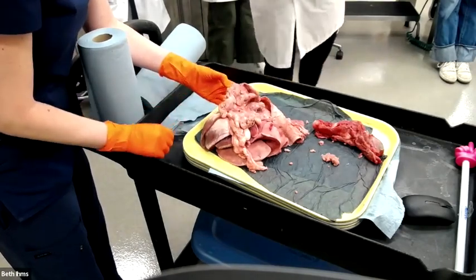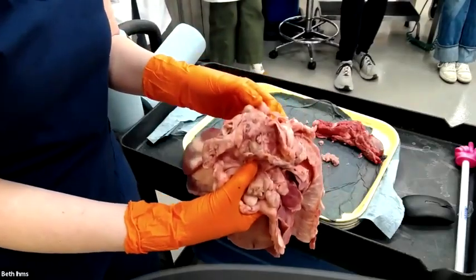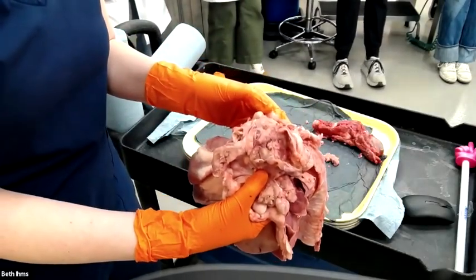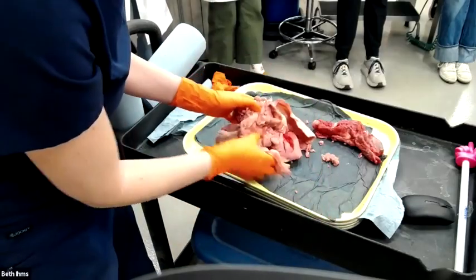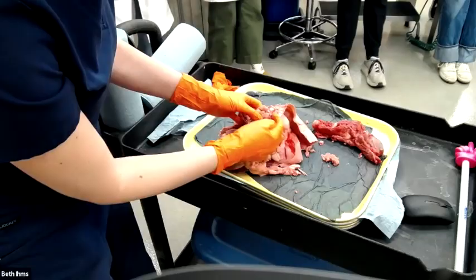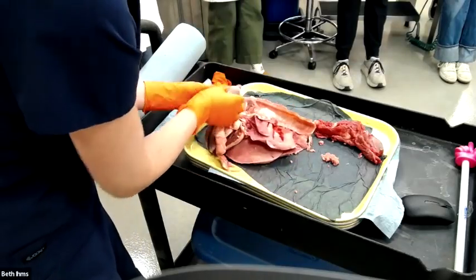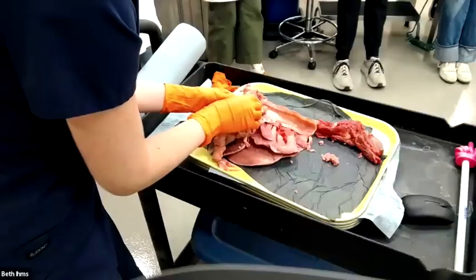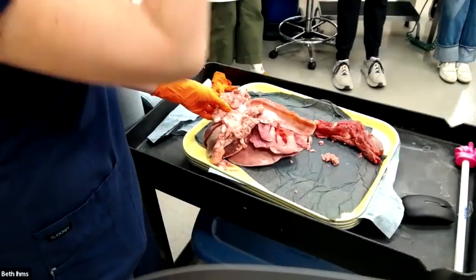Everybody see all those little holes? It's cystic. This thing right here was probably a big focal cyst, all of that right there. So it's nodular, it's multicystic. What about texture? Is this thing holding together real well? Soft, firm, hard?